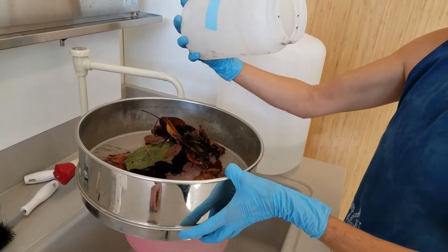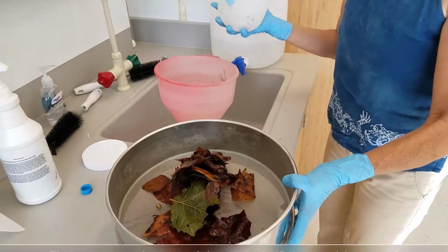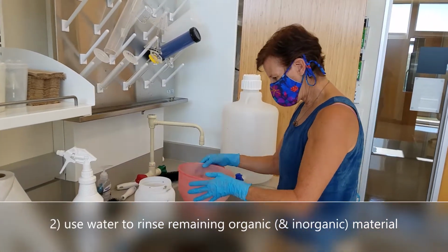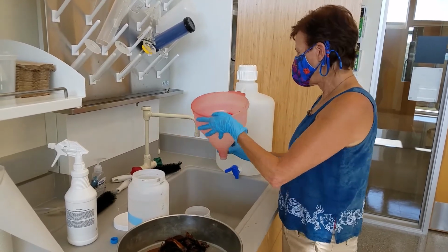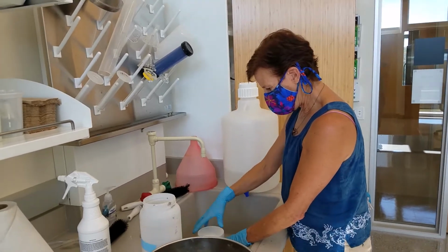I've got a lot of leaves in here and some debris, so I'm going to just use regular water to rinse this out. At this point, I'm not really worried about the ethanol, so I'm going to remove that from the mix here, move it out of the way.